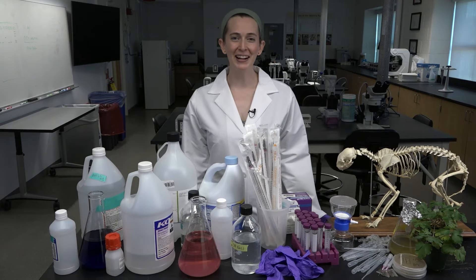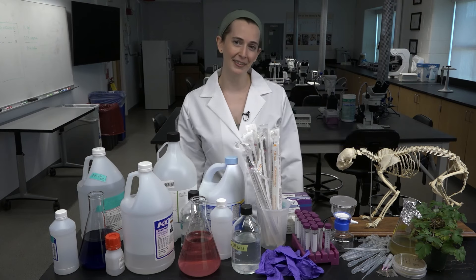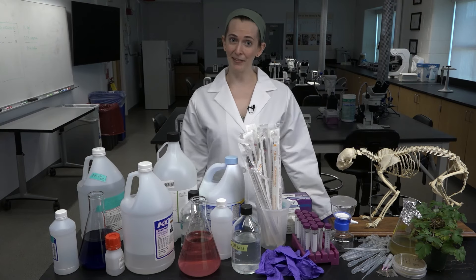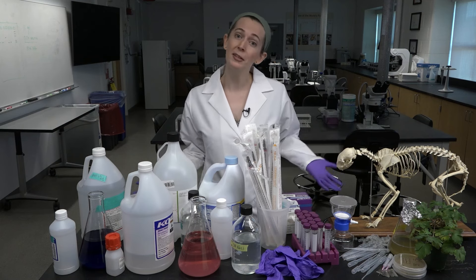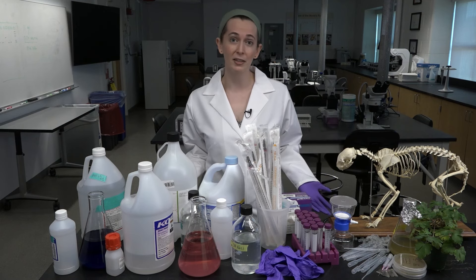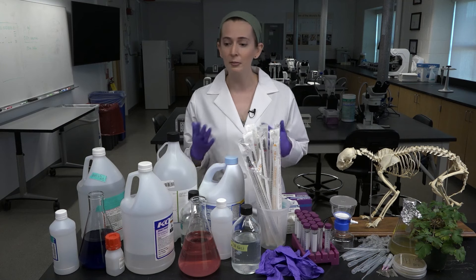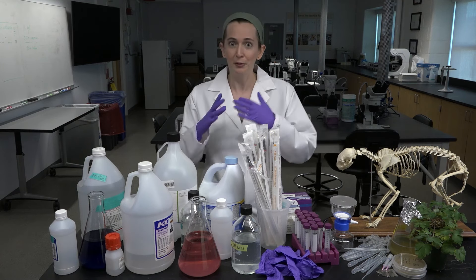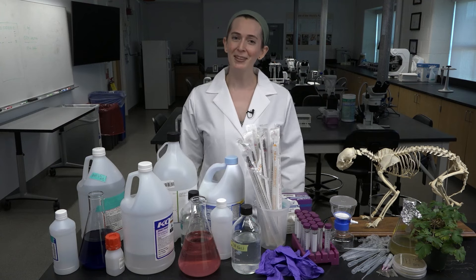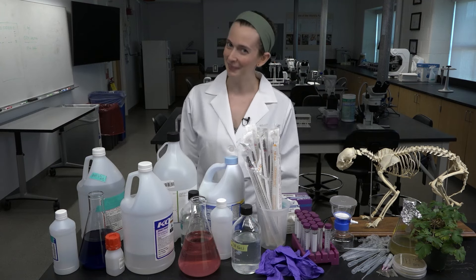Waste is a fact of lab life, but luckily there are tons of super knowledgeable health and safety officers to tell us what to do with all of it. The types of waste we've covered today might be the only ones you ever encounter in your scientific career. Or you may eventually work in a lab that works with radioactivity, nanoparticles, or super infectious pathogens, in which case even more exciting waste disposal techniques await you.